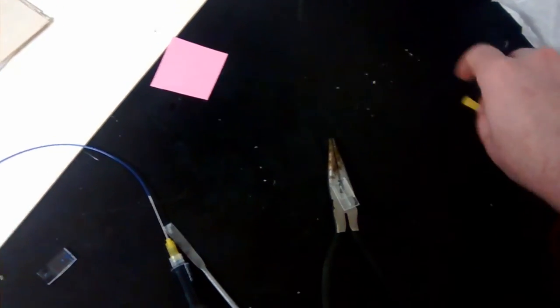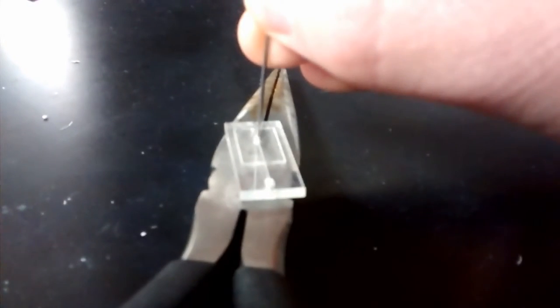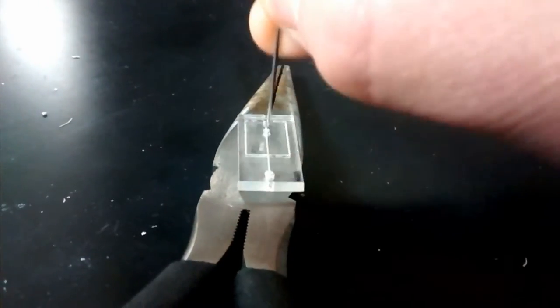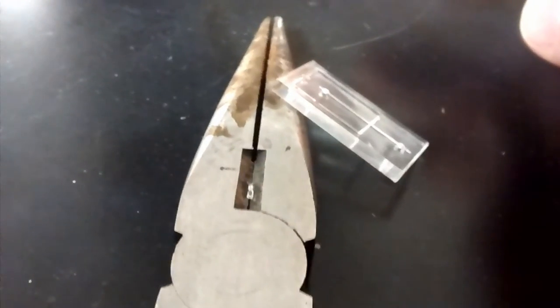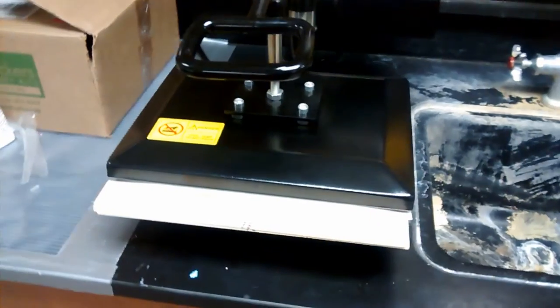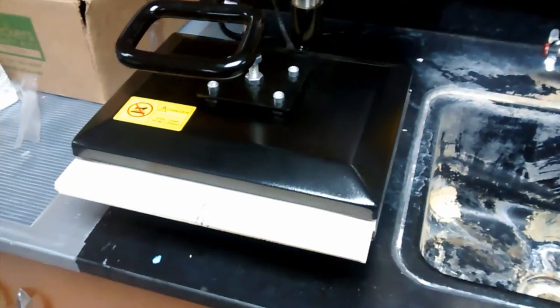Now those through holes leave a little plug of acrylic so I use a syringe needle to pop that out. I've set my substrate on a pair of pliers so you can see the little plug that comes out more easily. It's also good to push against a void space where the plug can come out easily. But there it is, the little plug sitting in the groove of those pliers.